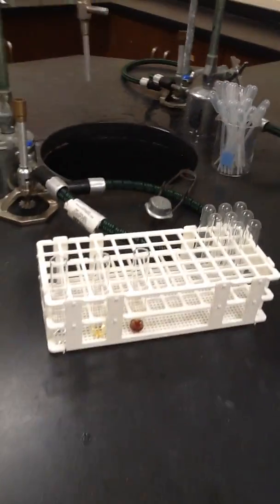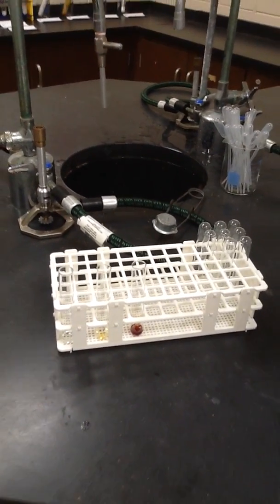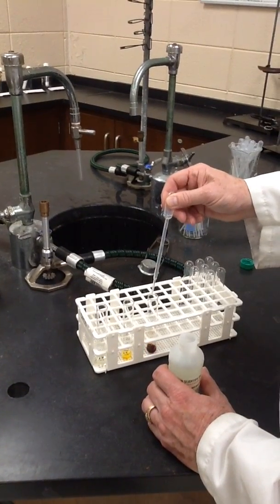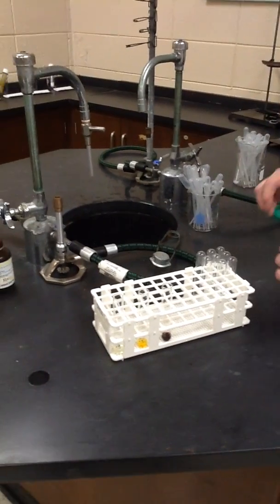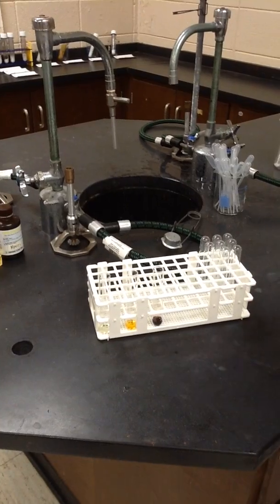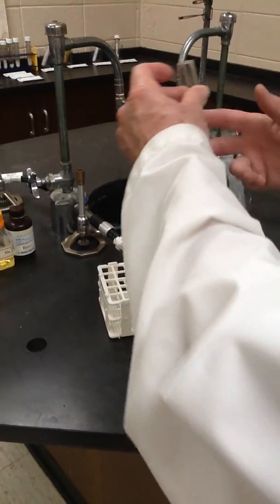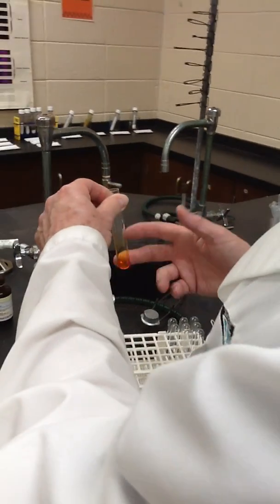But we're not complete yet until we add 3 drops of the sodium hypochlorite, or bleach, to each tube. You, of course, don't want to get that on yourself or your clothes. It would form a little white spot on any clothes you expose it to. I'm going to agitate my tubes. I don't have a vortex mixer here, but I use my fingers in the classical sense.